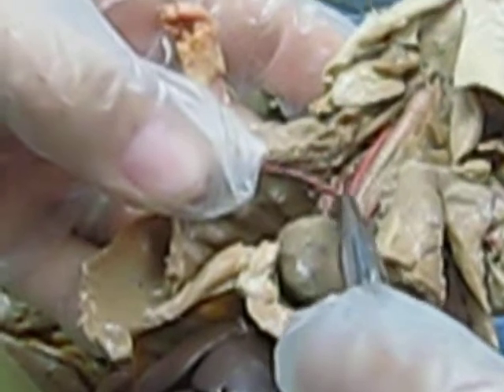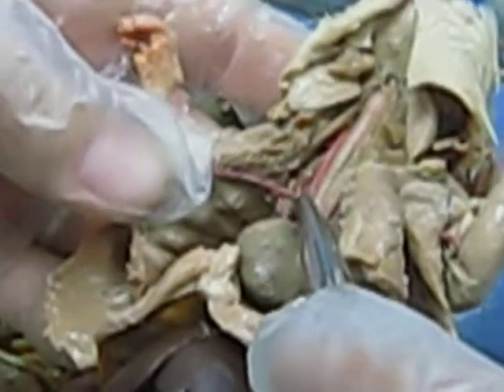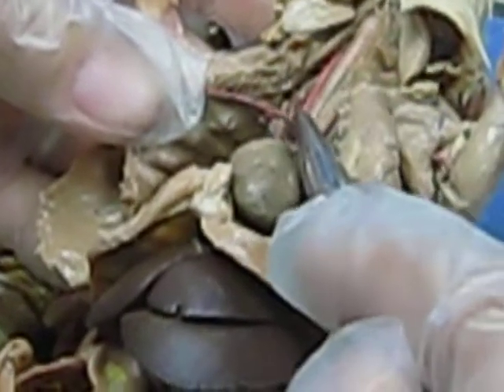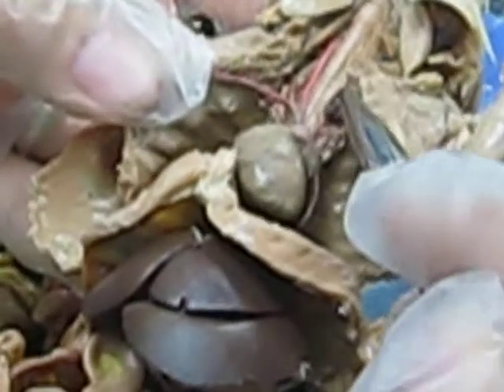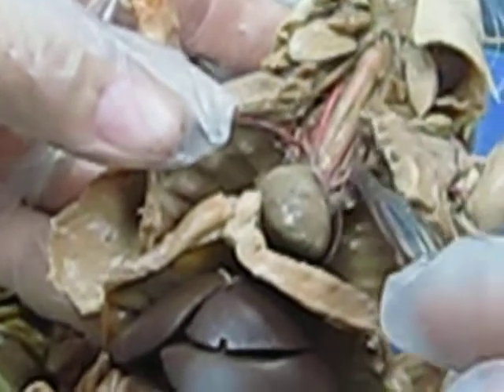So that little point where they're fused together is called your brachiocephalic trunk. So it's brachiocephalic trunk and then right common carotid and right subclavian, whereas on this side you have left common carotid and left subclavian as two separate parts.